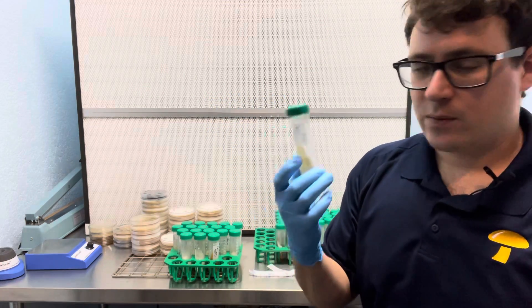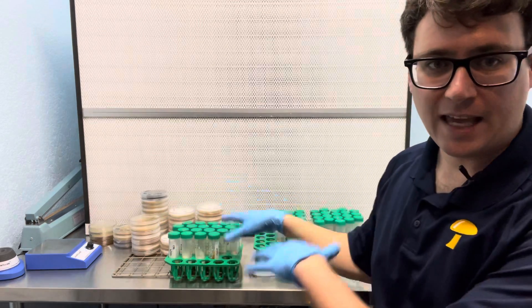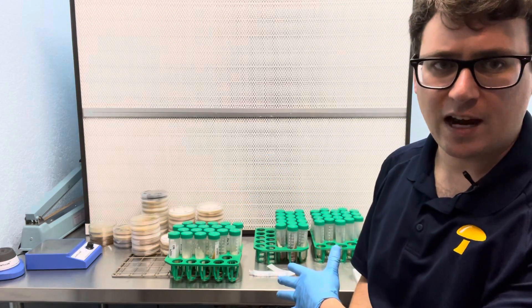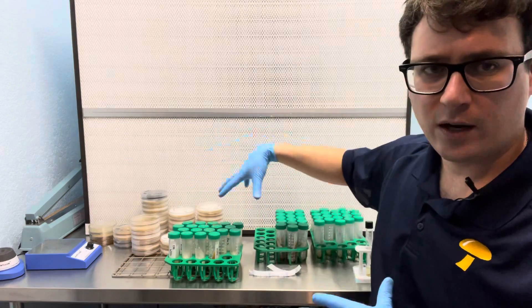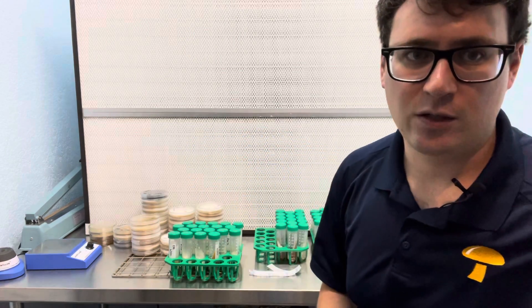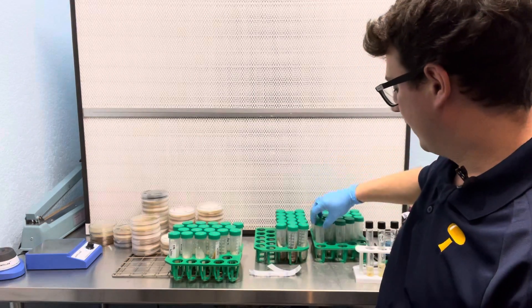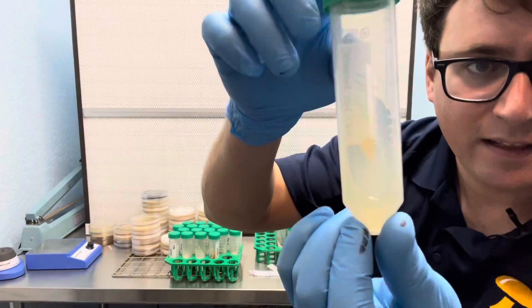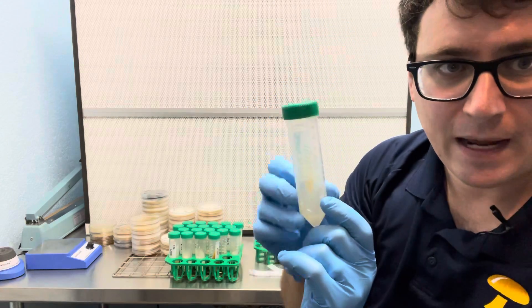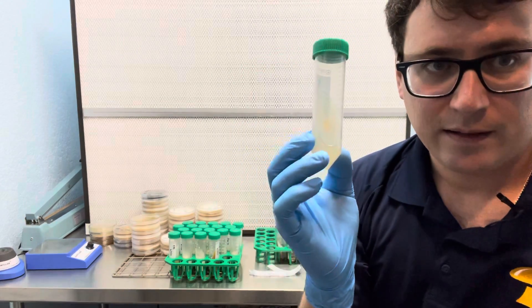So I just wanted to go through some slant culture care and preparation strategies for storing these, bringing them out to make your transfers onto fresh plates. So I just recently transferred all these mycelium mated pairings onto slants.